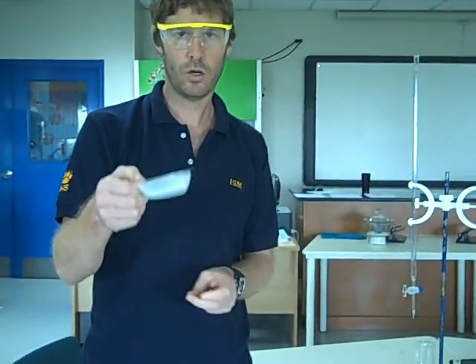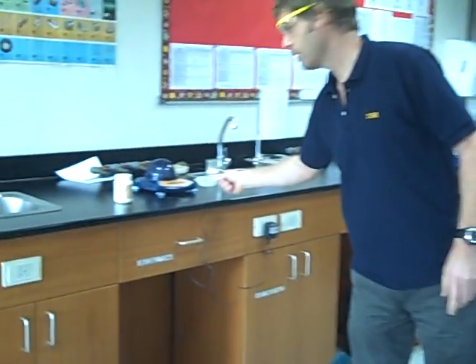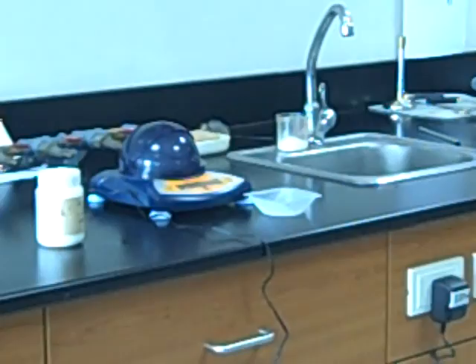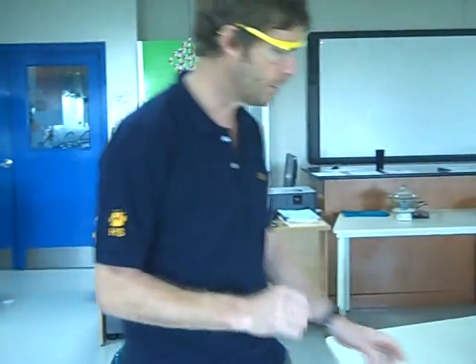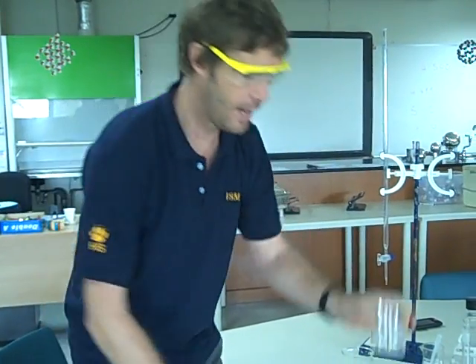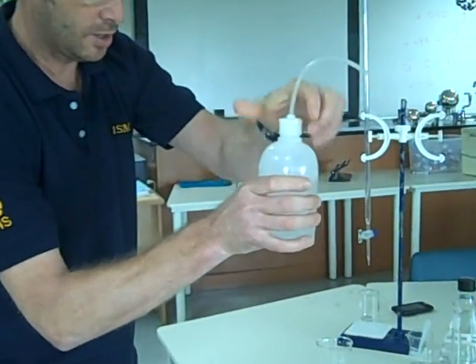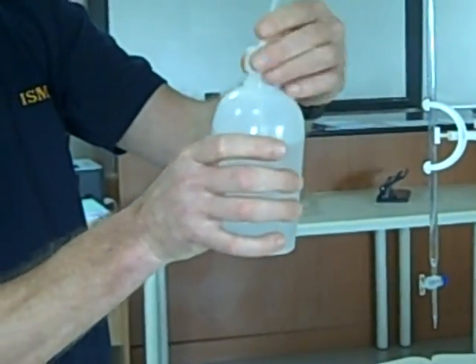Now, there may remain in my weighing boat some crystals of the oxalic acid. Well, you're going to just re-weigh that so you've got the mass of the empty boat. You can subtract the two to find out how much acid you've actually added to here. It then says dissolve in distilled water and make up to 250.